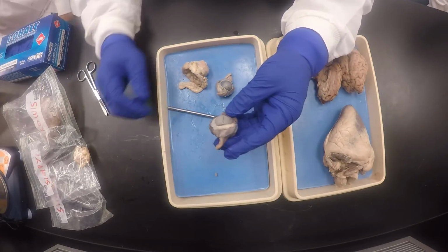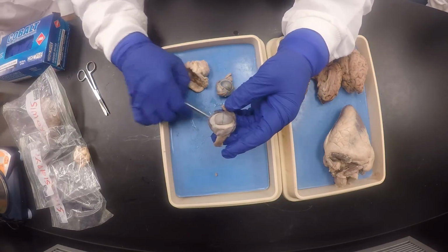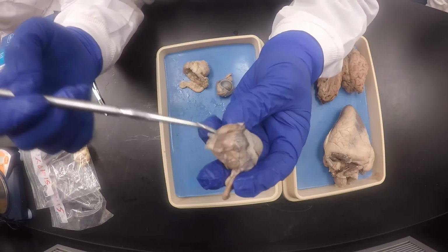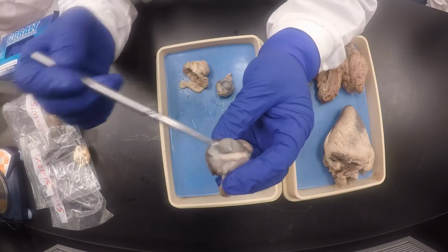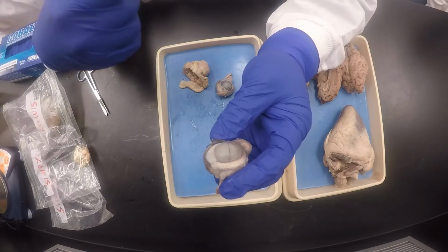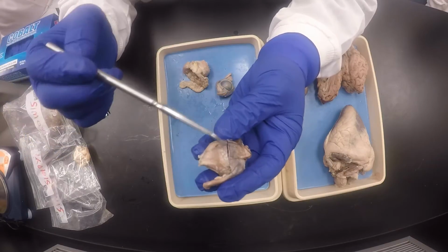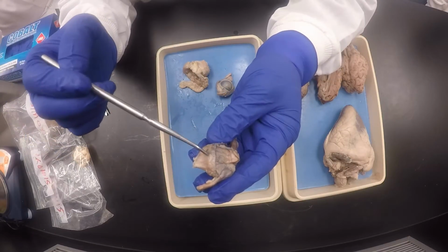Before you do anything, you wanna identify the extrinsic eye muscles. So what do you do? Yeah, of course. You look at the short side. This is a short side, that's a short side, that's a long side, that's a long side. So you look at this short side because it was convenient. I just looked at it. Boom. It's only one muscle there.